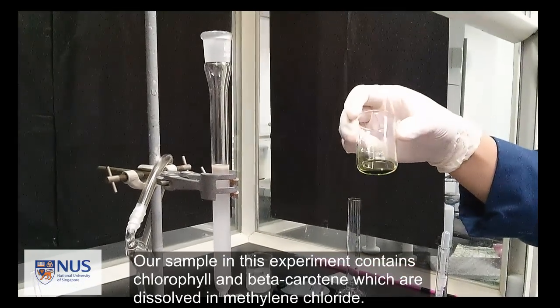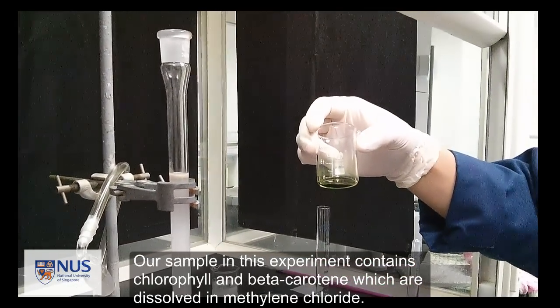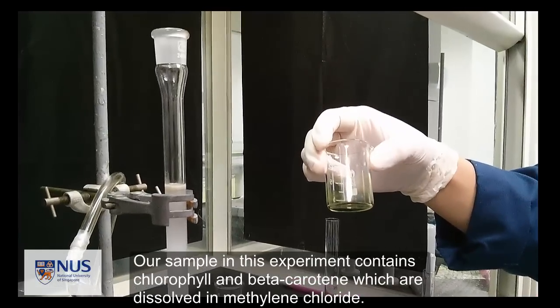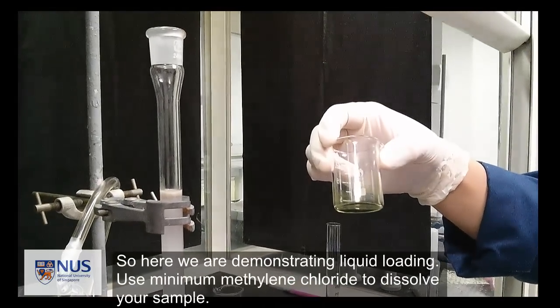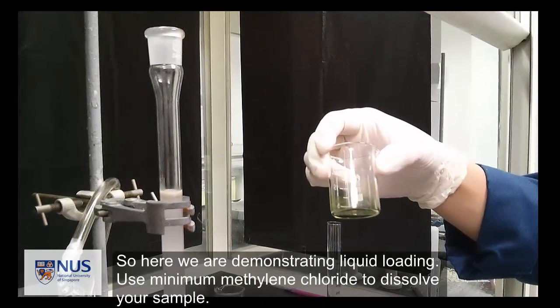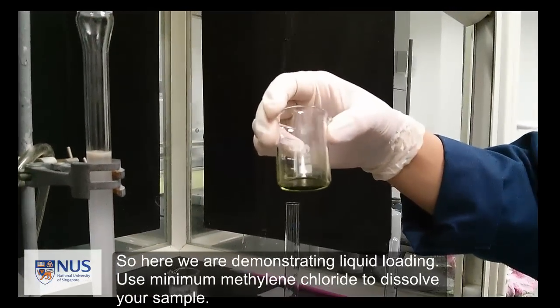Our sample in this experiment contains chlorophyll and beta-carotene which are dissolved in methylene chloride. So here we are demonstrating liquid loading. Use minimum methylene chloride to dissolve your sample.